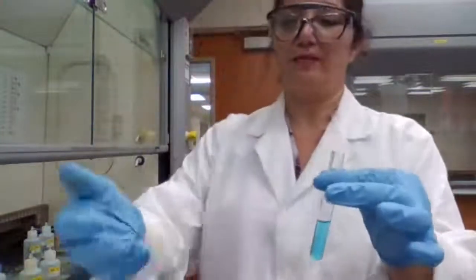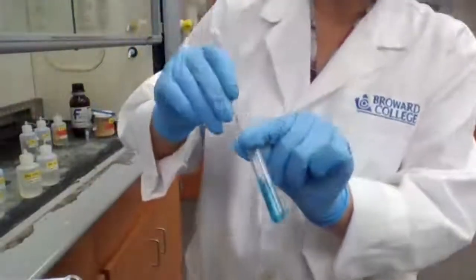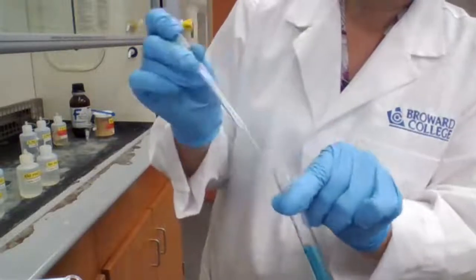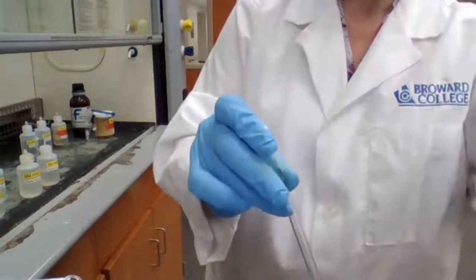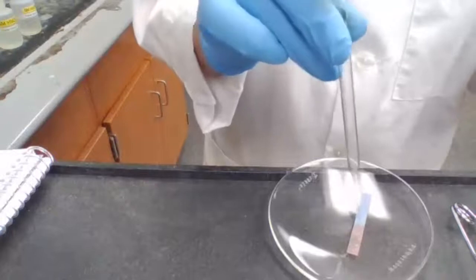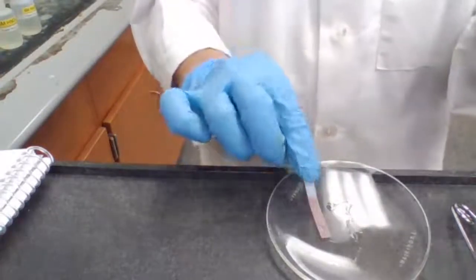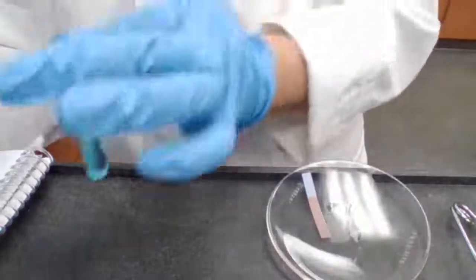I don't want to test too often, because if I add one drop and test it to see if it's acidic or not, of course it's not acidic. Nothing happened to show me any change, no evidence. But after there's the color change in the solution, I can now add drops to the litmus paper that I have in the watch glass. And I could see it is changing color from blue to pink, and the solution is acidic.